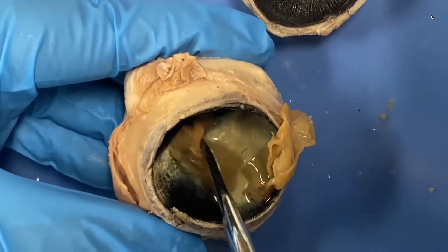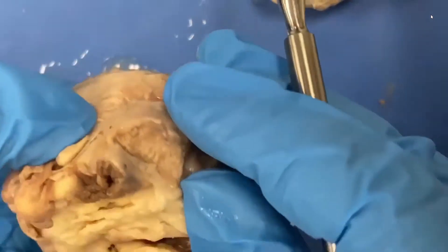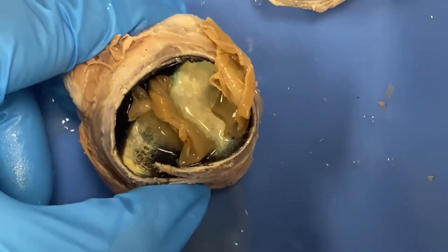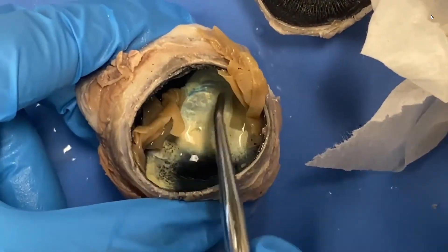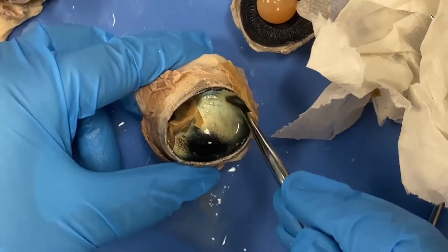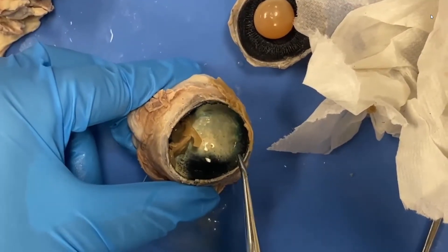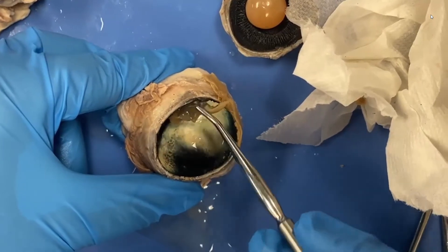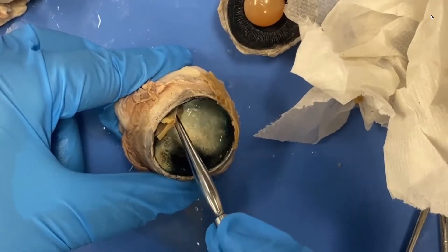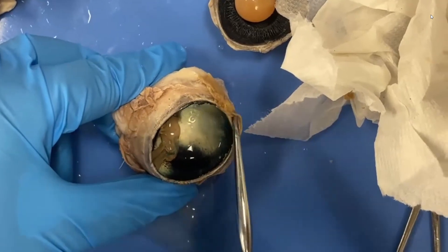So if we take the optic disc — what do you think it ends up being? If we flip that over and watch, it's right where the optic nerve would be. So if we follow that nerve all the way back down, we would get to the optic disc. Now you notice there's a pretty layer underneath the retina here, and it's sort of this blue-green color. We don't have this. This layer that's blue-green does not exist in us — it's called the tapetum lucidum. It exists in many animals, including cats. What it allows is for light to reflect back and forth in the posterior cavity so the retina gets stimulated more. You need that when there's less light — maybe in the dark. A cat's eyes glow in the dark because of light reflecting off the tapetum lucidum.